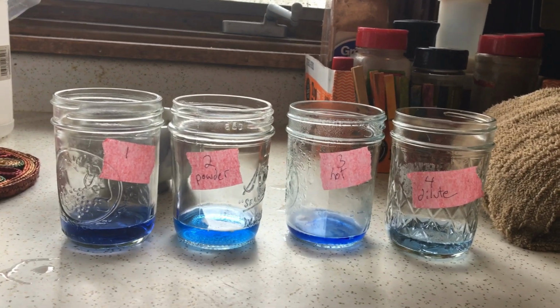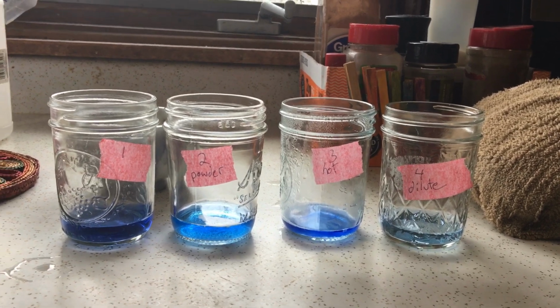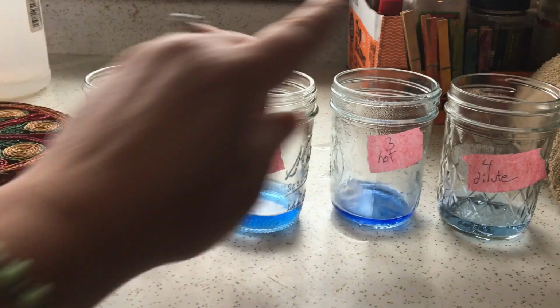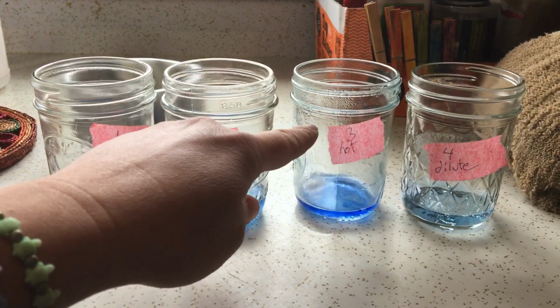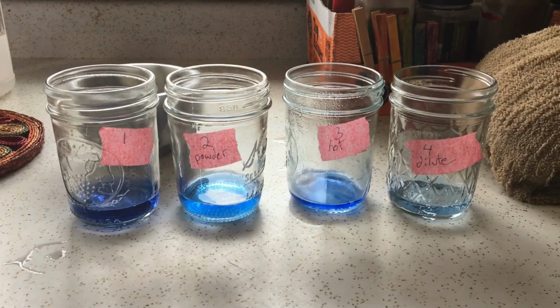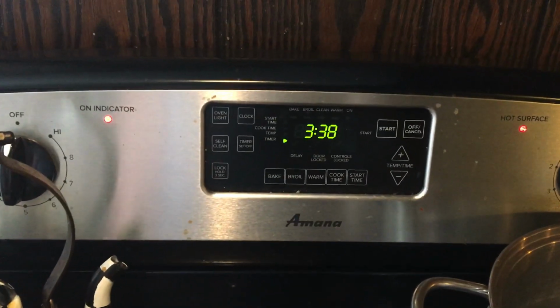We are going to let these sit for a few minutes, maybe stir them and swirl them a little bit to try to help them dissolve, and then we'll come back and see what the differences are between different factors. For example, diluting your acid, making your acid warm, or powdering one of your chemicals, okay? So, meet me back in just a few minutes. All right, set my timer for 5 minutes, and let's take a look.